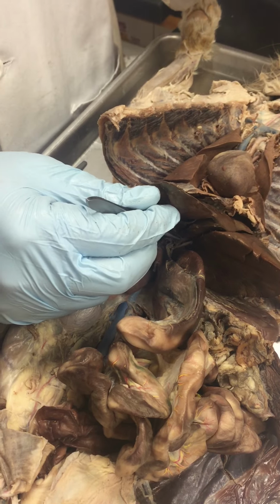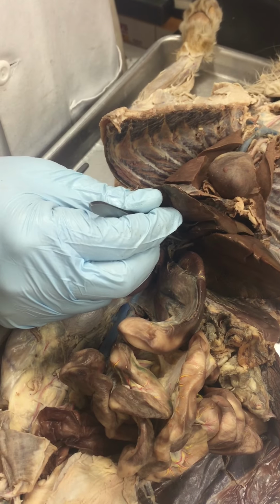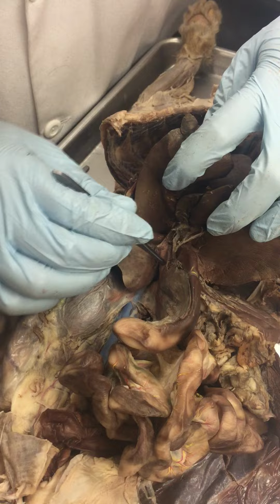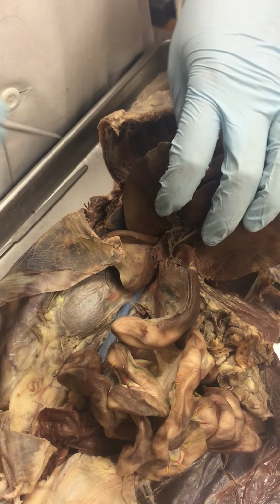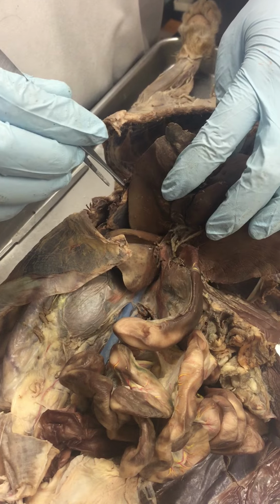Once it's further processed, further digested, it redistributes to the whole body. So the other parts could directly use them or store them. Okay. So on the hepatic portal system, at least you should know where the hepatic portal vein is. That's the last part that directly goes to the liver, showing yellow.